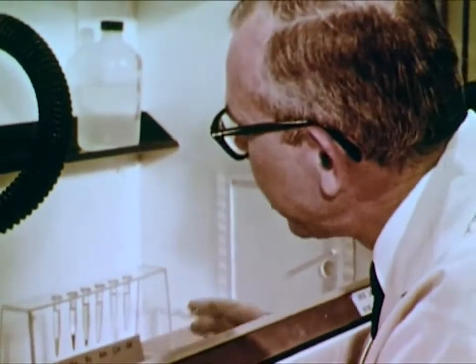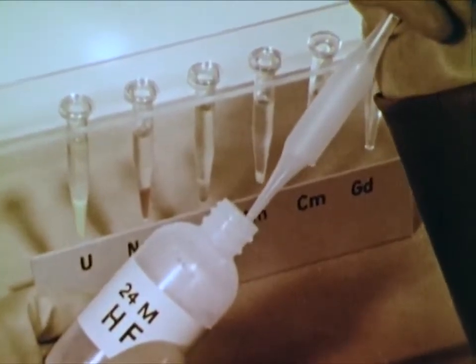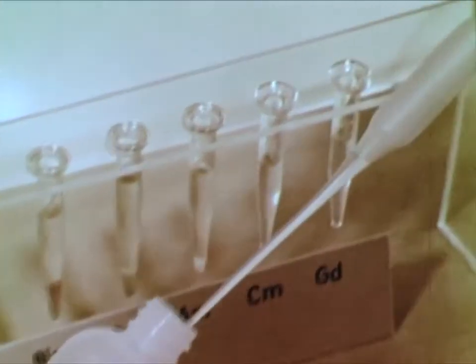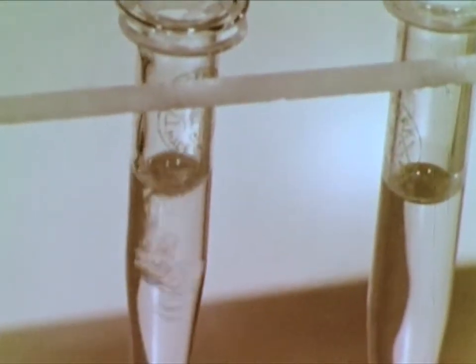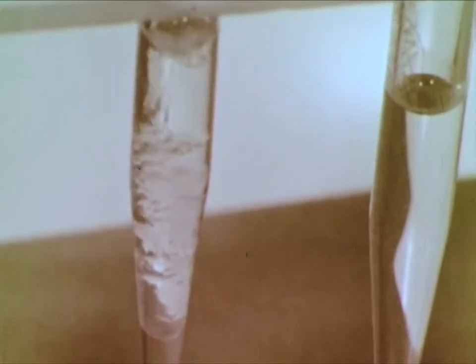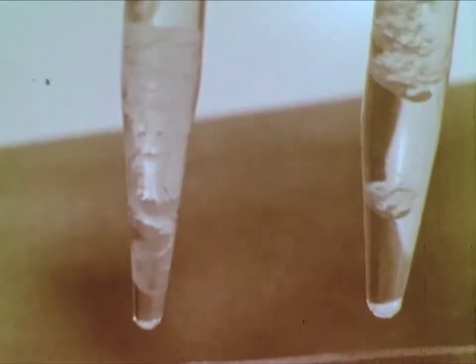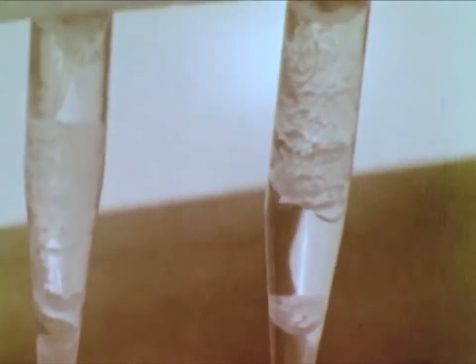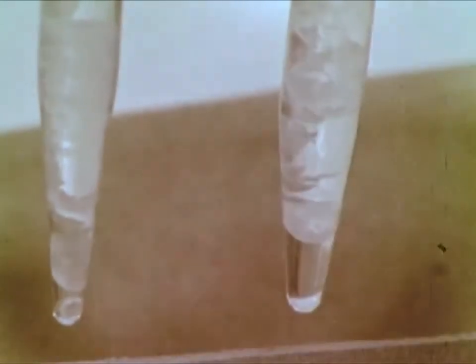So we see that although curium is a transuranium element, it is not a uranide or uranium-like element. Let us see now what we can find out about the oxidation states of curium and gadolinium. We'll add hydrofluoric acid to our solutions of curium and gadolinium. A trifluoride of curium forms as a jelly-like precipitate. This characteristic precipitate indicates that both elements remained in a plus-three oxidation state.